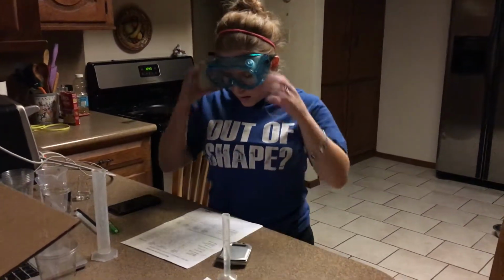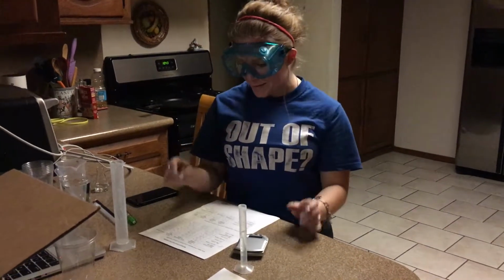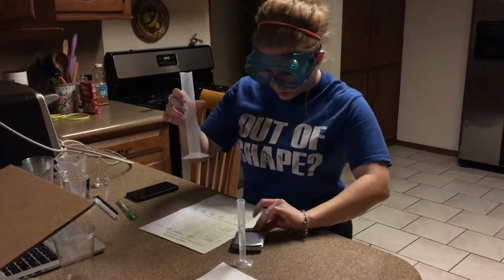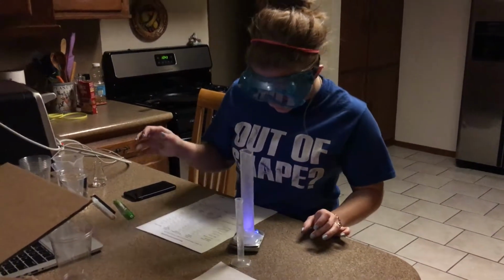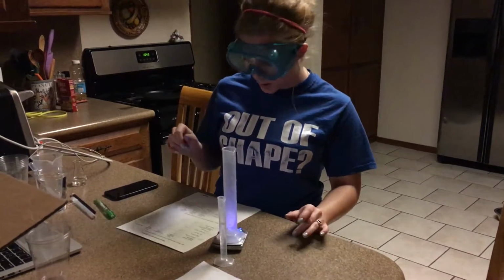So then I'll go over to the 50 milliliter. Oh, it's hot. Let's see. Okay, I'll just weigh that real quickly. Try to keep this under the time limit. And I get 29 on the dot.